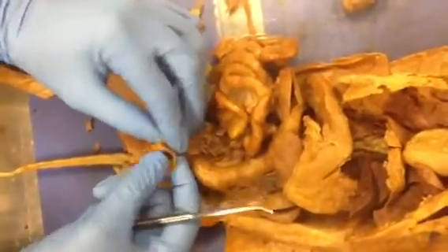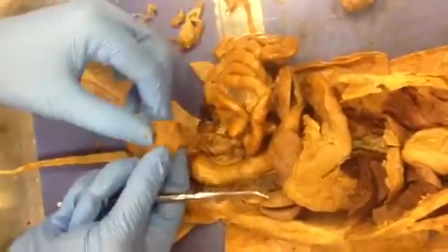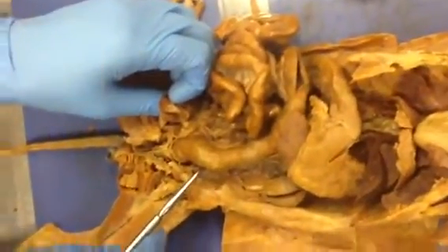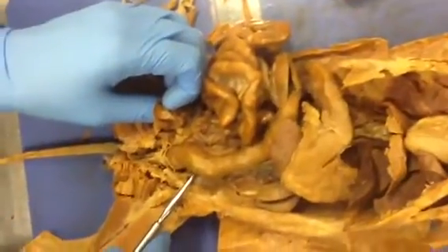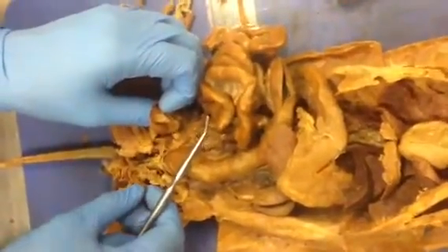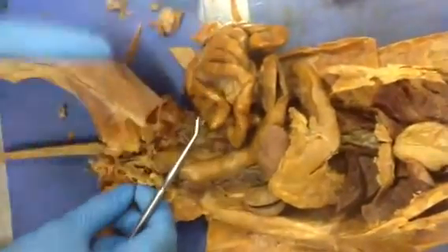For exam purposes, what epithelium is inside the bladder? It's transitional. And the epithelium inside the ureters also is transitional. Ureters and the bladder, the epithelium is the same, transitional. But don't worry about that now, we'll go over it next time.